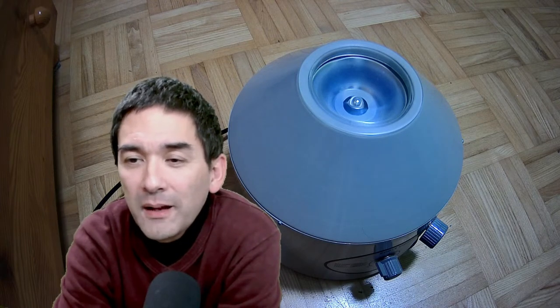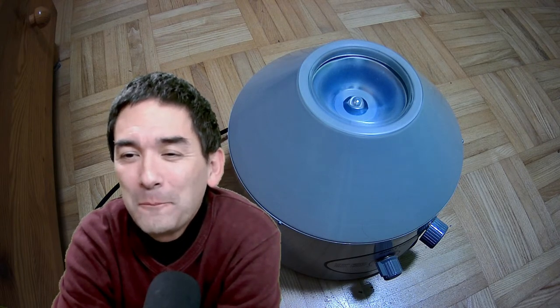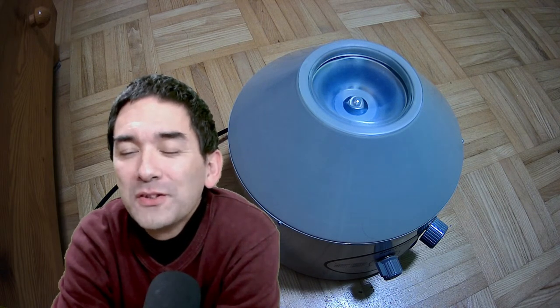What are we looking for? The coffee is simply a demonstration of principle — maybe we'll see a few coffee particles. For the other sample I hope to concentrate some algae. I haven't tried this specimen yet, so it's going to be a little bit uncertain for me as well.